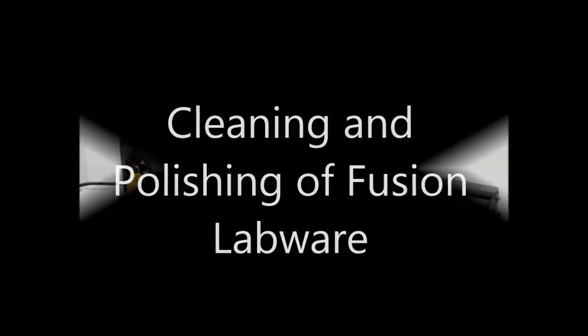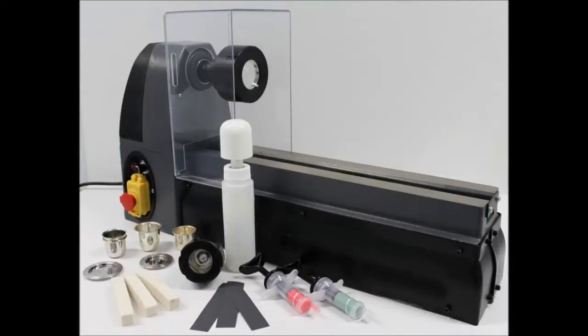The lathe seen here can be used to obtain high analytical accuracy and repeatability, retain the calibration curve via flat surface retention of the mold, and minimize fused bead sticking or cracking if the surface is uneven. Additionally, it can also allow for a more intense XRF spectrum and repeatability, and have the added benefit of extending the life of the platinum labware to reduce the refabrication costs.